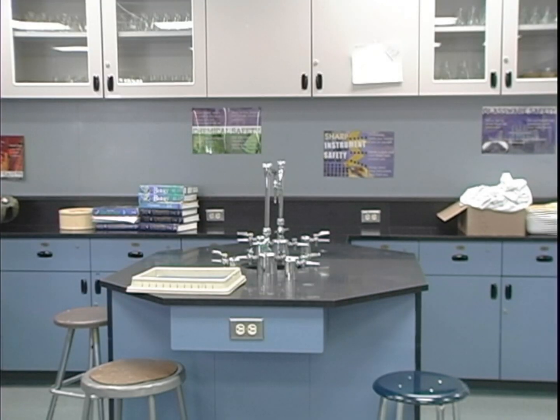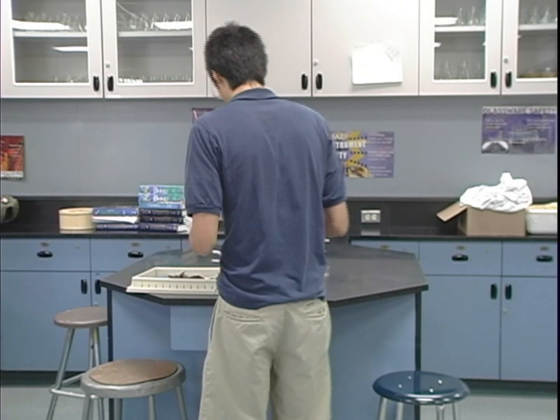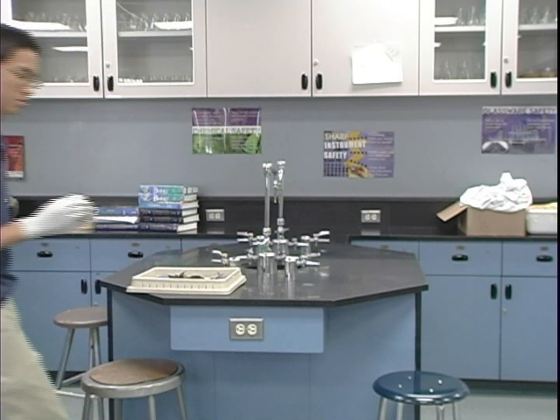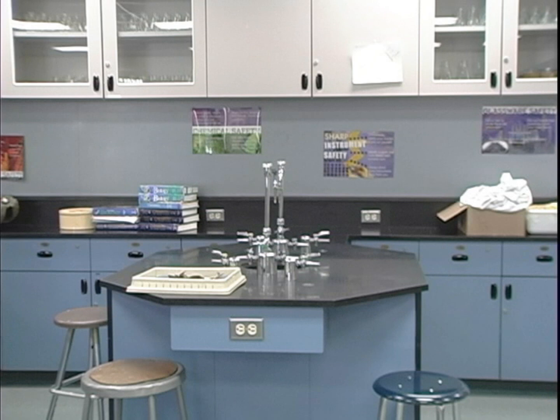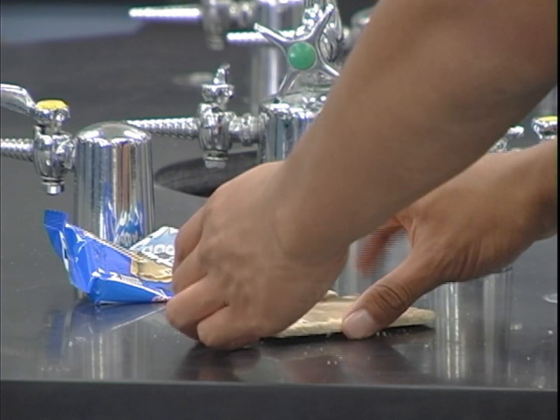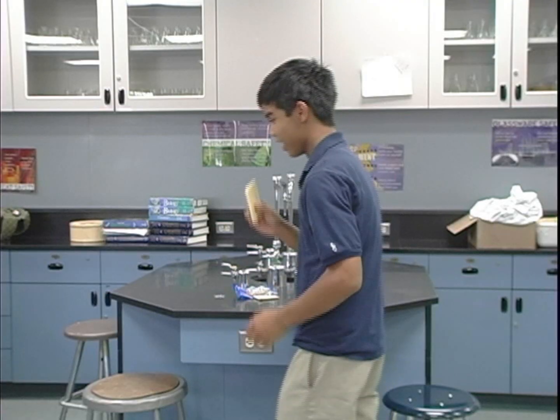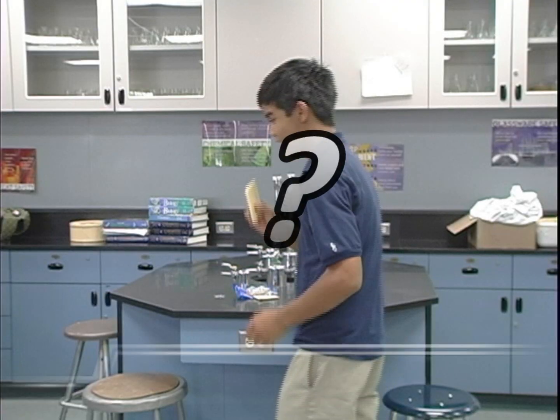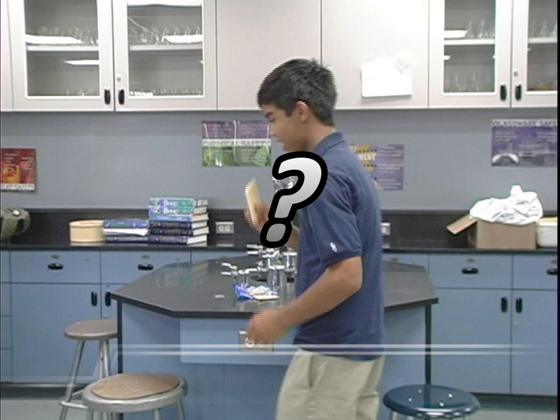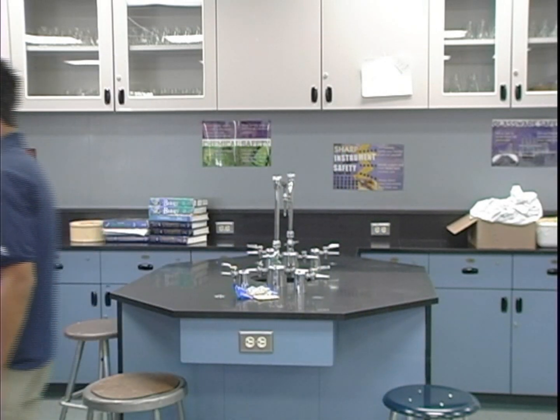Take this student, for example. He's in a rush and forgot to clean his table after a dissection because he wants to be the first one to the lunch lines. And now look at this student. He didn't have time to eat his lunch, and now is going to. But that's just an exaggeration. No one would actually eat off something like that, right? But what if it was a bacterium off a petri dish instead of a frog?